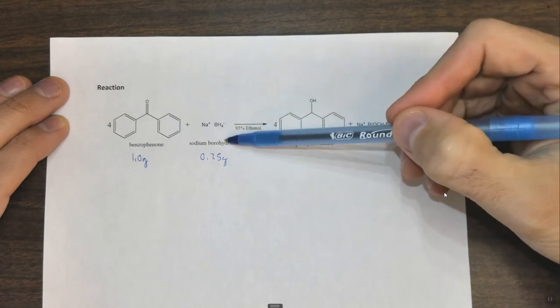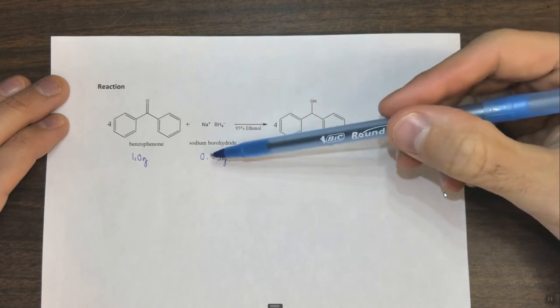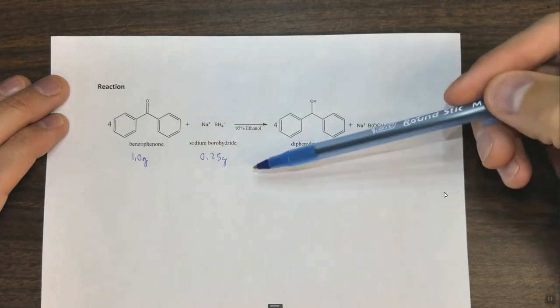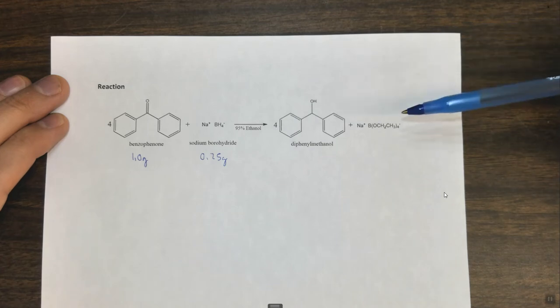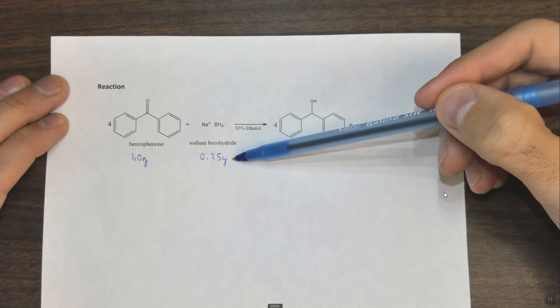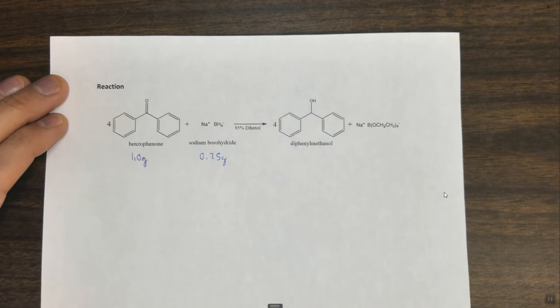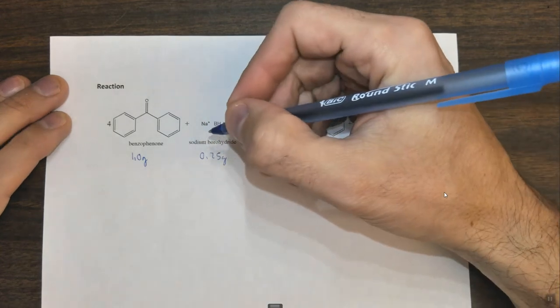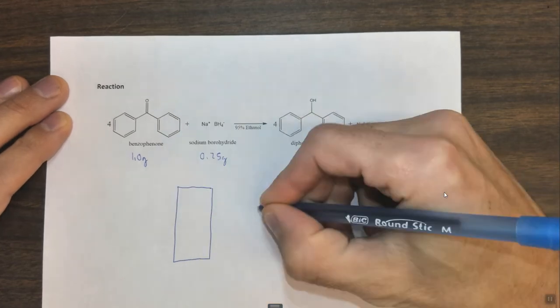We're going to divide this 0.25 grams of sodium borohydride into three equal portions. Visually, it doesn't need to be the exact same mass — you're just going to divide it into three aliquots and add those aliquots at different time intervals throughout the reaction. At each time interval, you will be adding sodium borohydride and also taking a TLC of that reaction mixture at that time. That's essentially what we're looking at here, so let's draw the TLC plates and go from there.